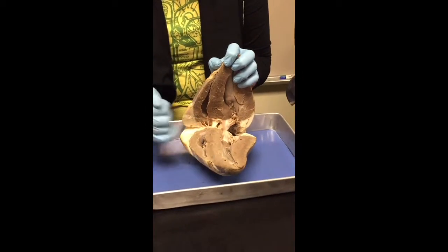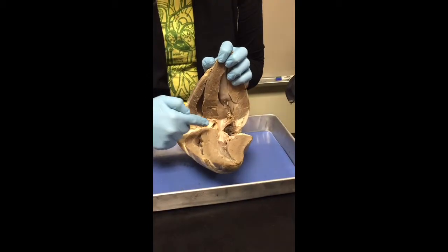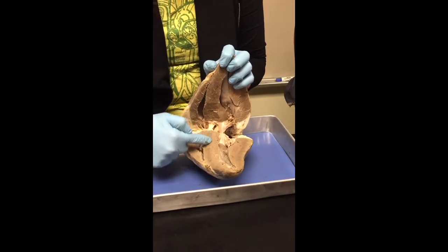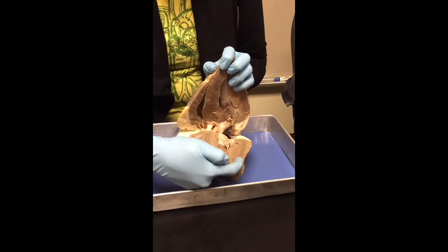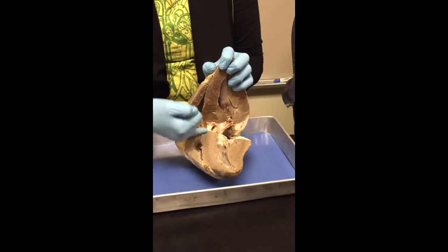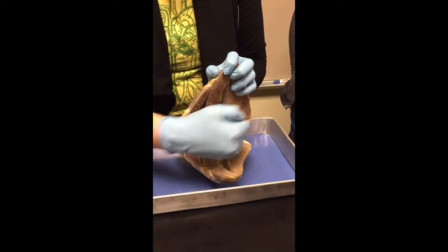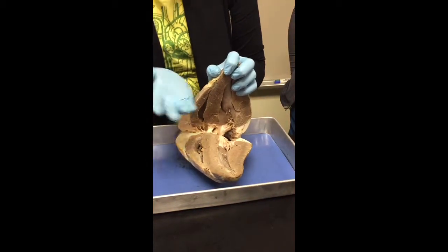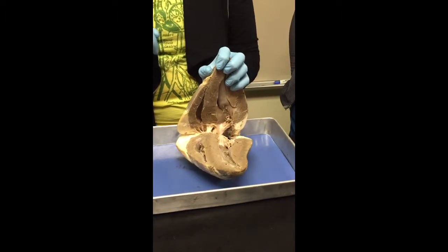This interventricular septum is going to be where those Purkinje fibers that come down from the AV bundle are going to run down this interventricular septum until they eventually curve upward and innervate the ventricles. So that's where they travel down, okay? Right? So this is where you'd find the Purkinje fibers, and then they would come up and wrap upwards and innervate the ventricles, causing the contractions. All right?